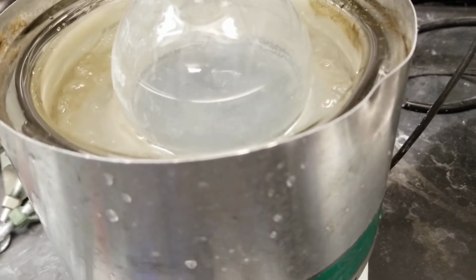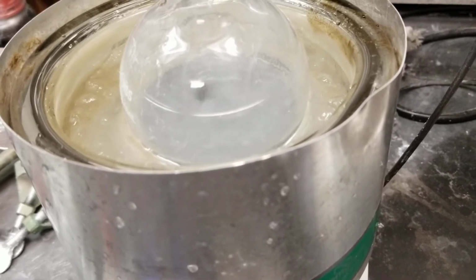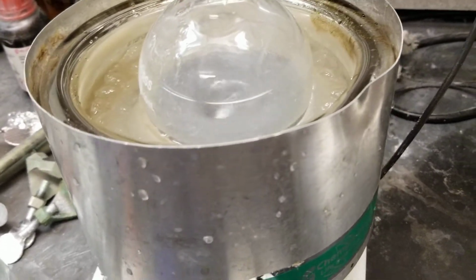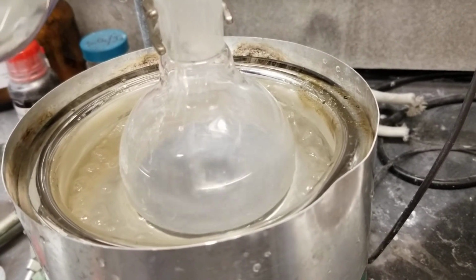So I'm starting to add in this, and this is just water at this moment. And I'm doing this slowly, and let's see if we see any change occur in the reaction vessel itself. Seems to be behaving relatively well. So let's see if we can speed up this process.